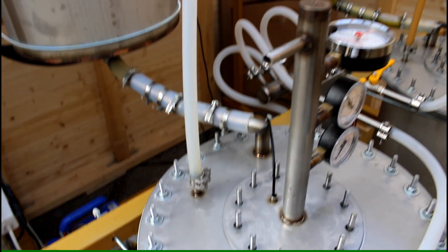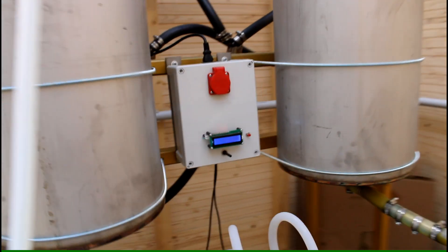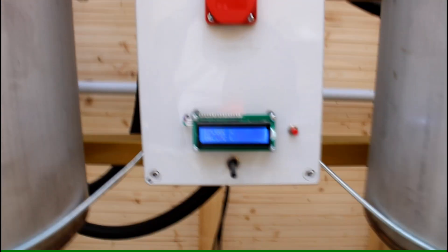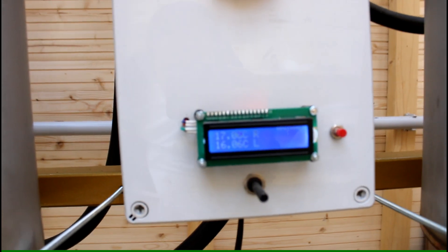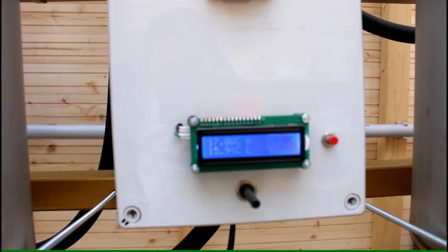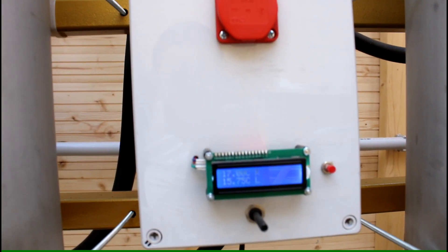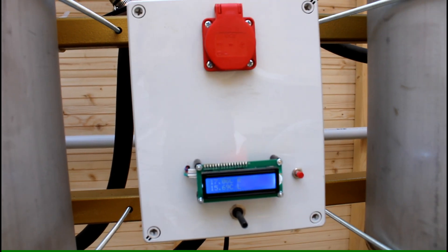Now then I will have always the temperature. I can demonstrate this quickly. So I switch the temperature on and here this little thing here shows me the current temperature from the left and the right boiling tank.